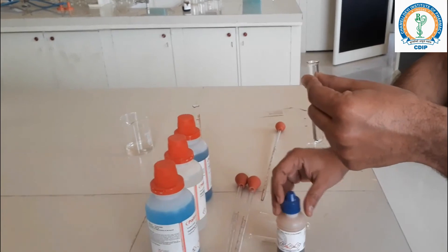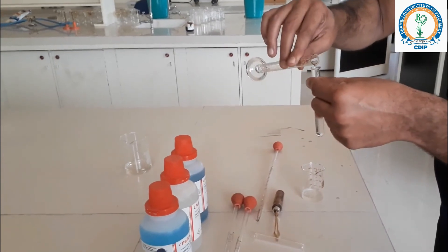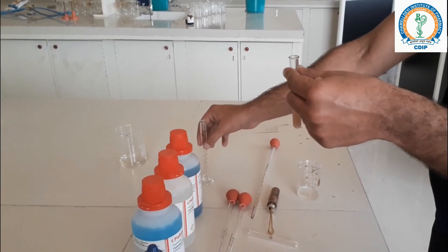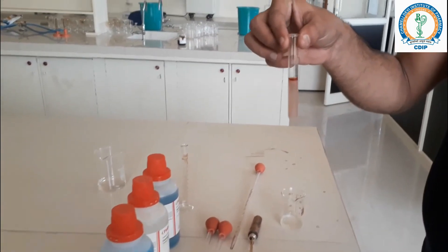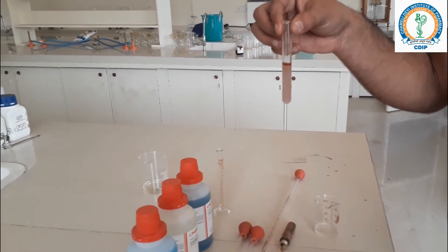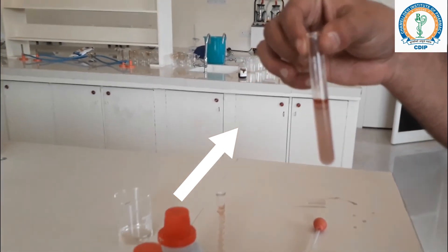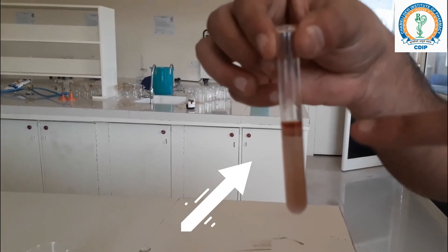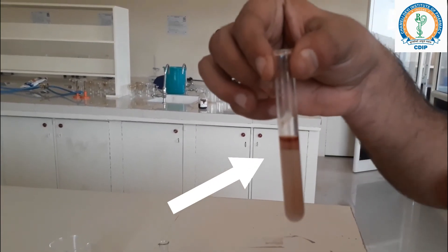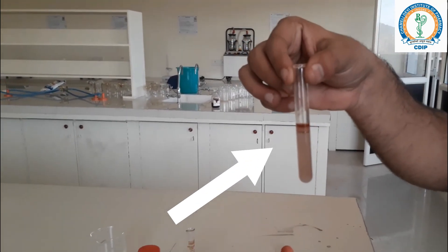Add 1 ml of concentrated sulfuric acid. Now, you can see here the violet color throughout the solution, or a violet ring at the junction between the two solutions. This indicates the presence of carbohydrate.